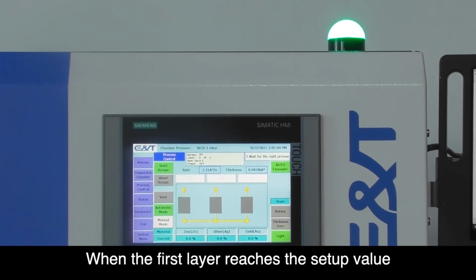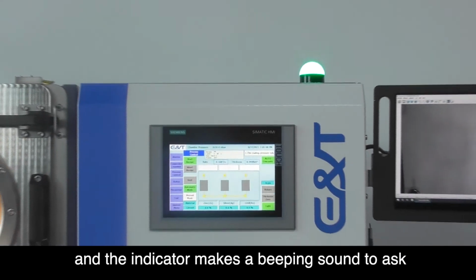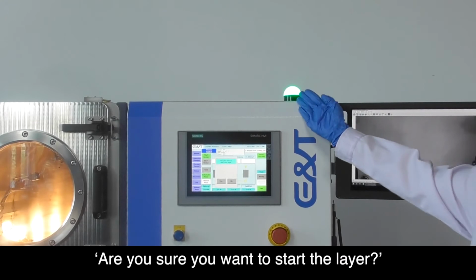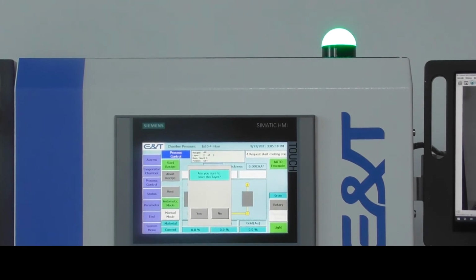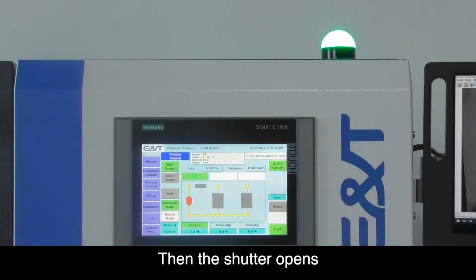When the first layer reaches the setup value, the shutter closes automatically and the indicator makes a beeping sound to ask, "Are you sure you want to start the layer?" The operator only needs to click yes, then the shutter opens.